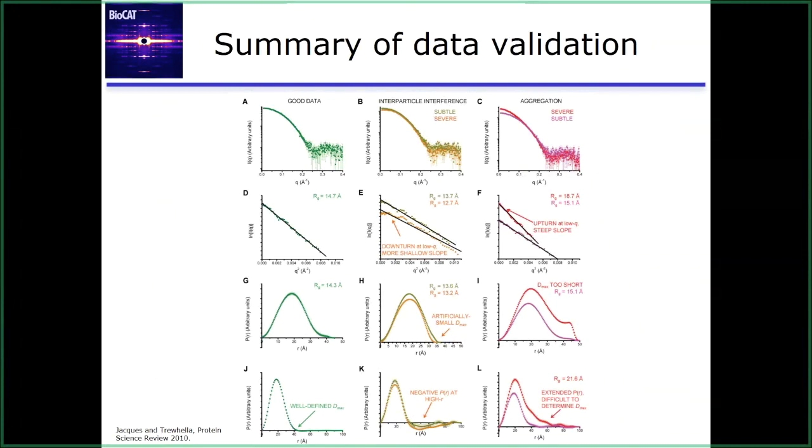The third row and the fourth row, yes. So the difference between the third row and the fourth row is that what they've done in this fourth row is they've extended the Dmax out to something much larger than what they were seeing here. So you can see in this case the Dmax is about 45, in this case it's 100. And so for something that's well behaved, you shouldn't really get any additional information in the P of R function. It should be flat and it's probably just going to oscillate about 0 a little bit. Whereas for something that isn't well behaved, it's going to show you a pathology like we're seeing in the bottom two plots.